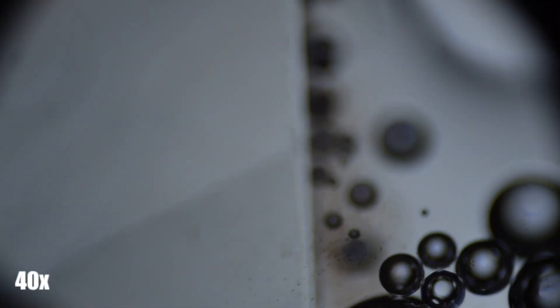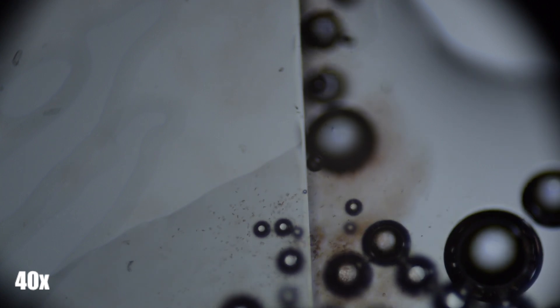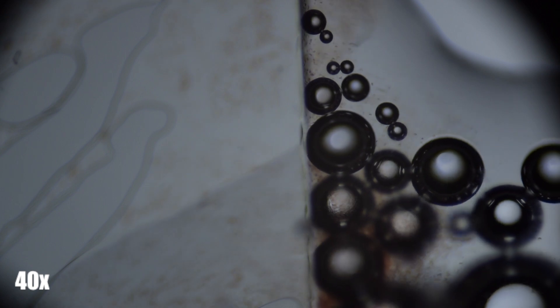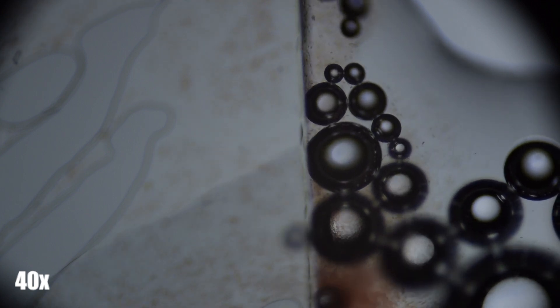Here you can see what happens when I put a drop of hydrogen peroxide onto the blood smear. The bubbles that you see appear are caused by the reaction between hydrogen peroxide and these blood cells, or more specifically, the hydrogen peroxide and an enzyme called catalase in the blood cells. This reaction converts hydrogen peroxide into water and oxygen, however, will destroy these blood cells. You may notice the cells acting erratically, and the gas bubbles getting larger due to excess gas being created.